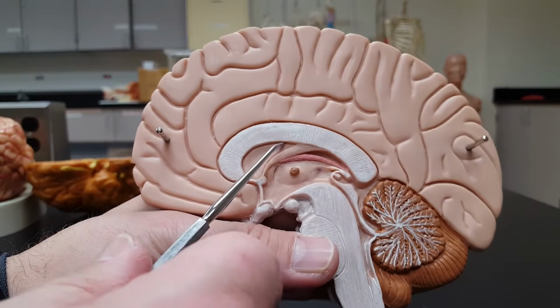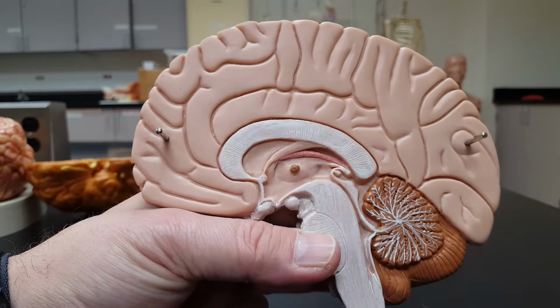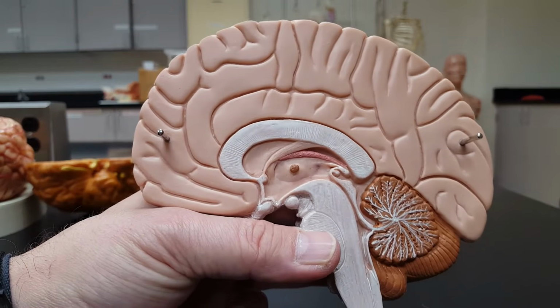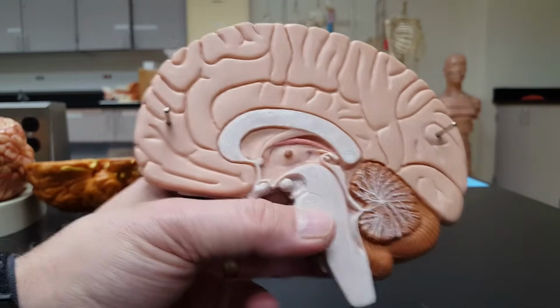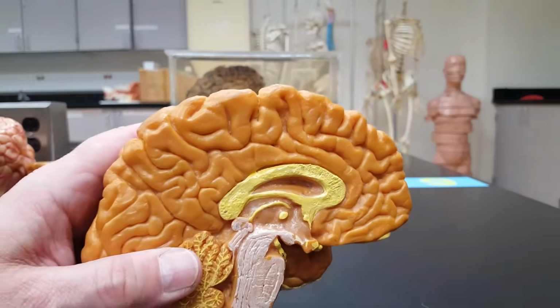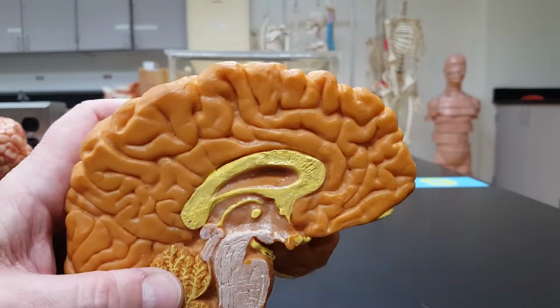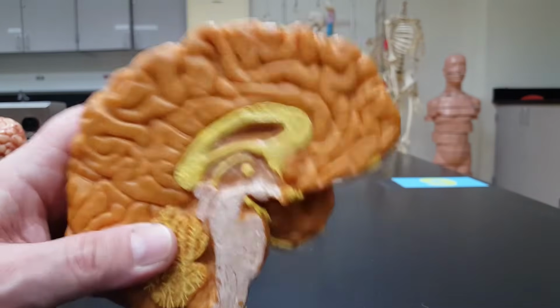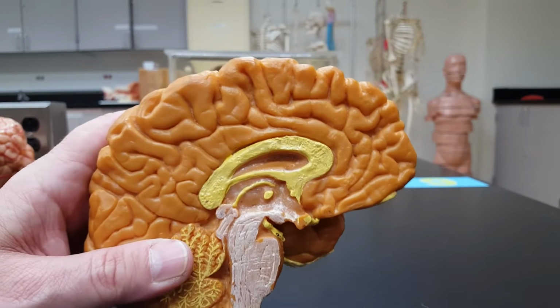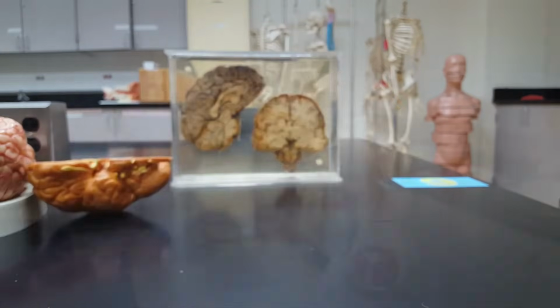Right here is where the lateral ventricle would be, but there's a wall there, septum pellucidum. I do have one particular model that shows the septum pellucidum quite nicely. This one does, you already saw it. Watch my probe, it goes right in there, that's a cavity, but it's not the greatest. Let's take a look at the single model I have here in lab that shows the best lateral ventricle.